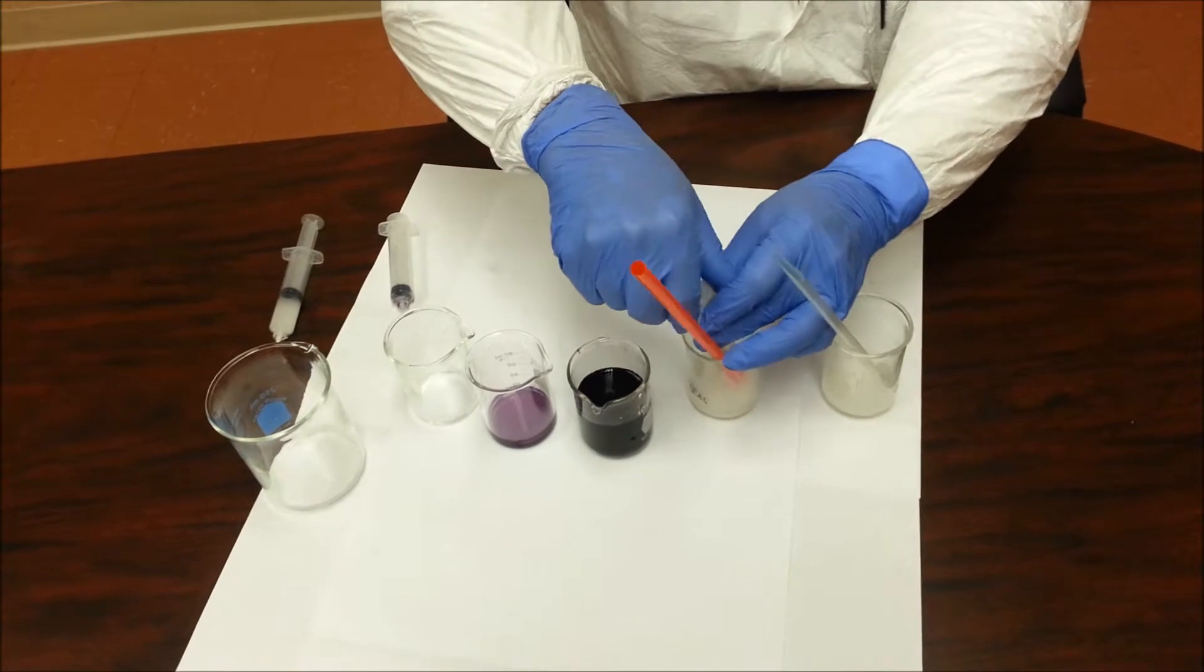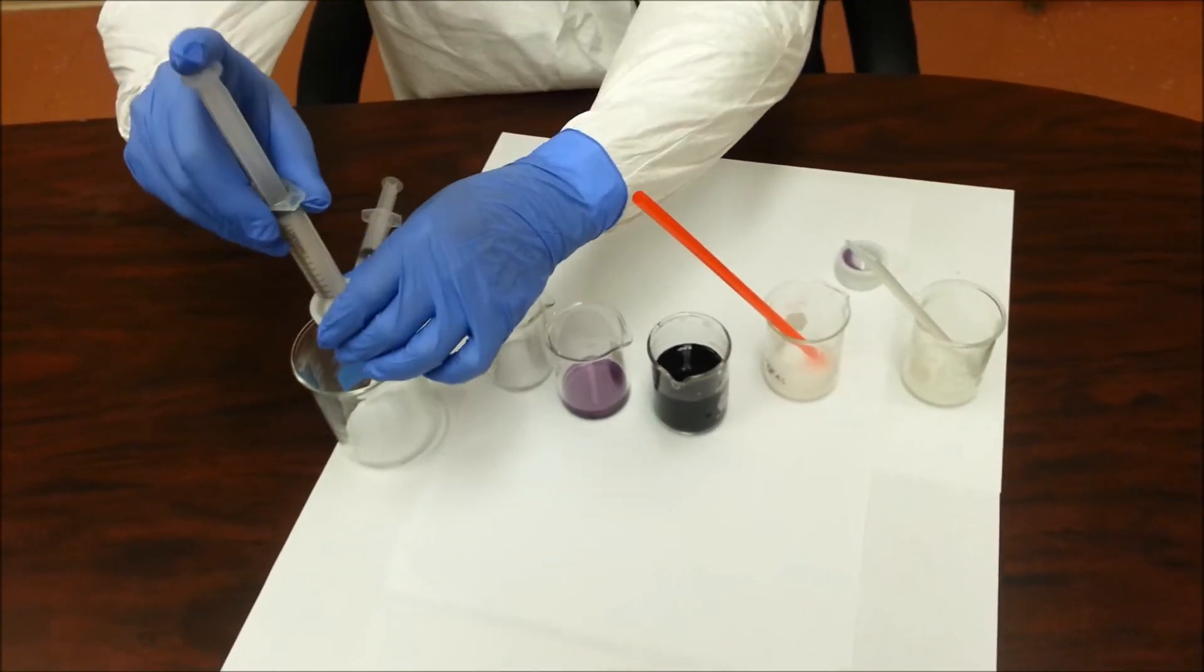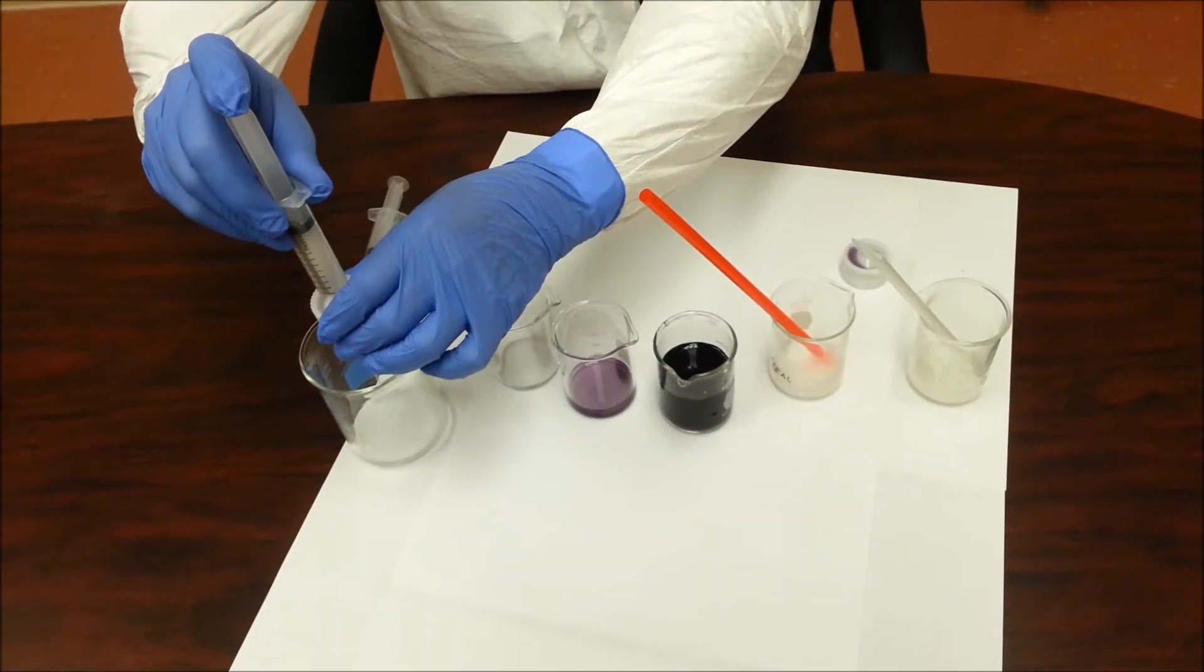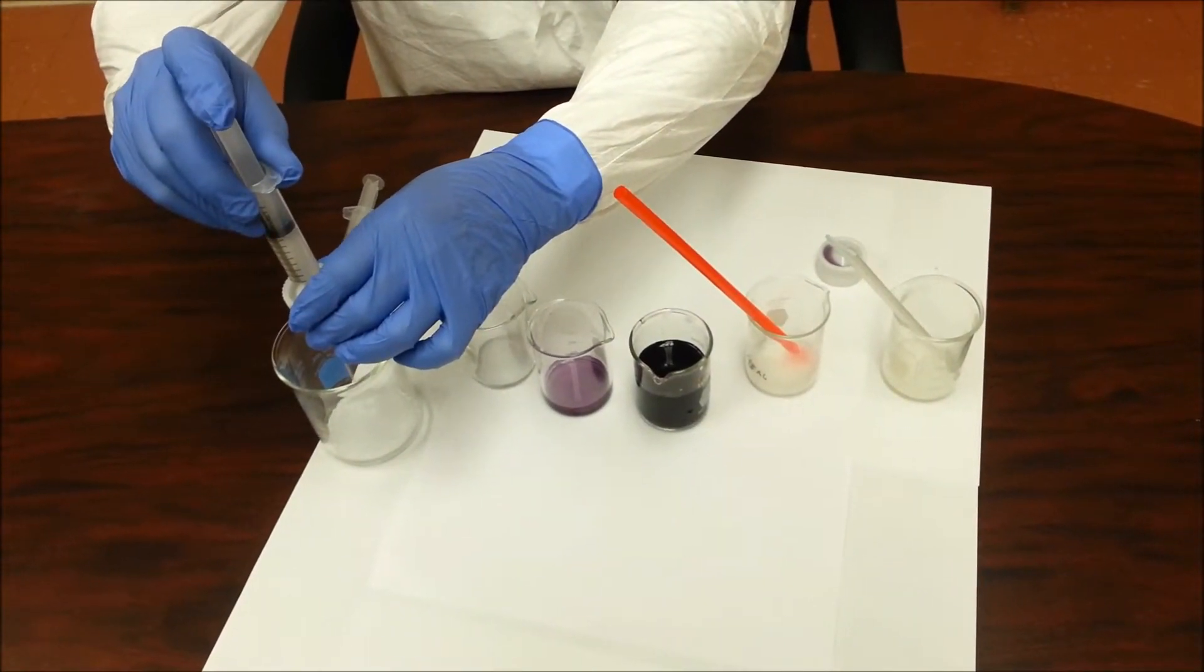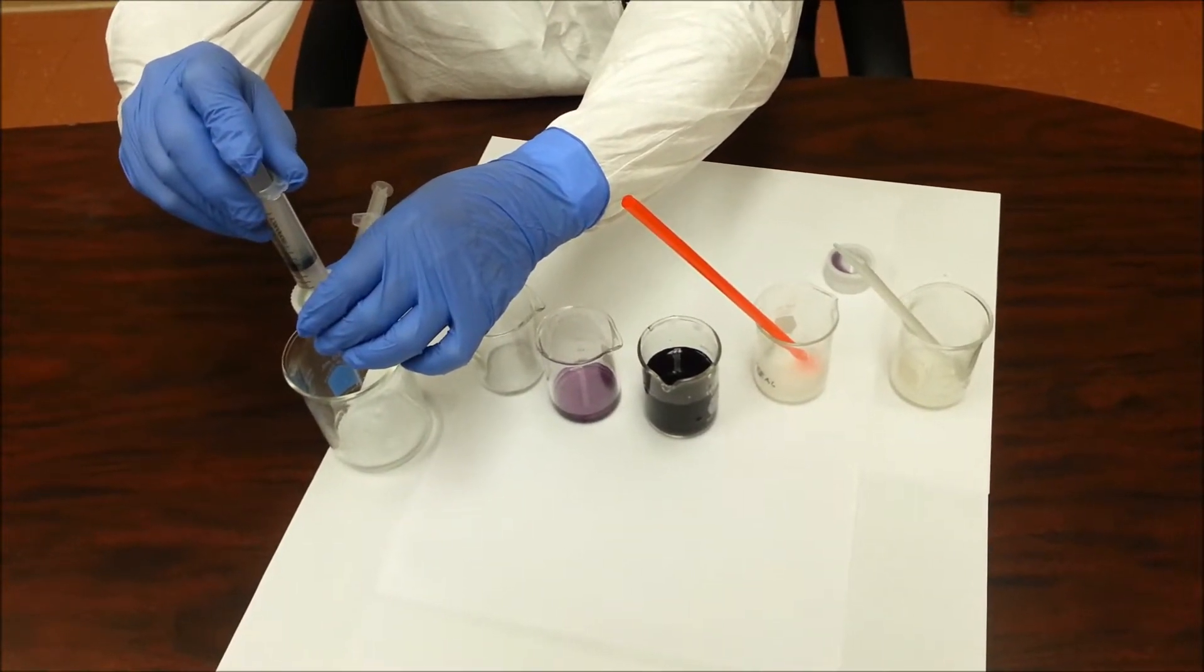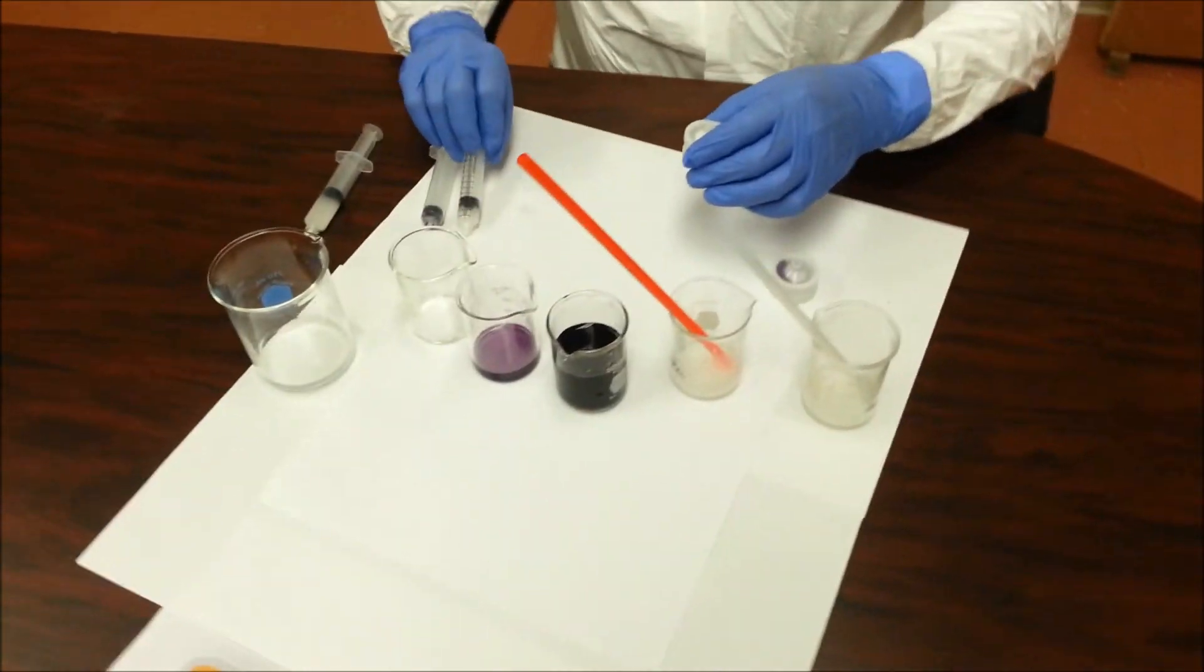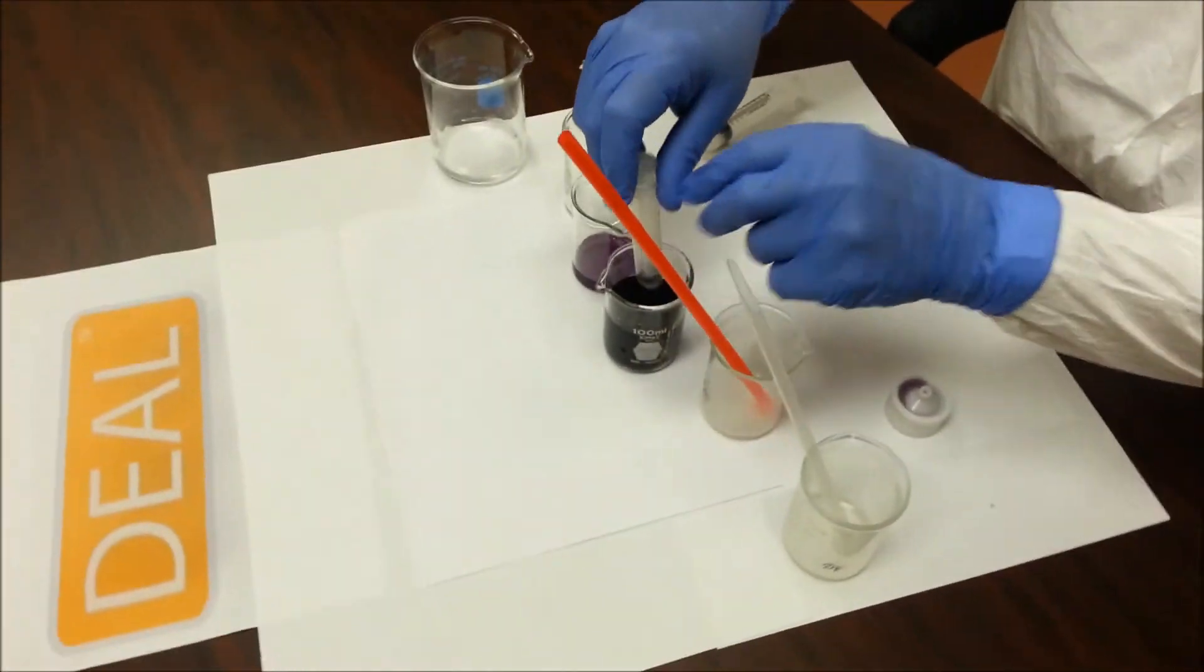This is diatomaceous earth with aluminum, or DEAL, in solution. And built up a three millimeter pre-coat.